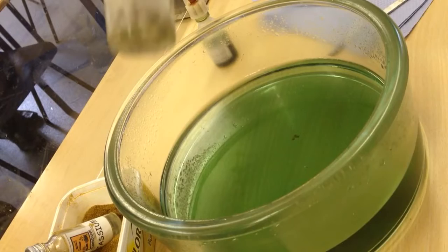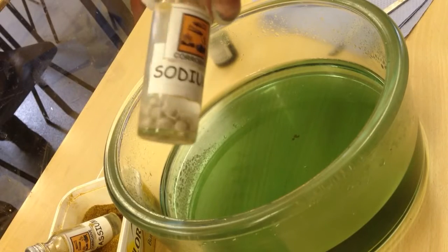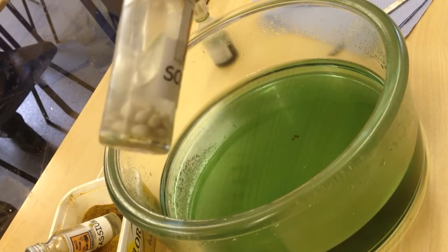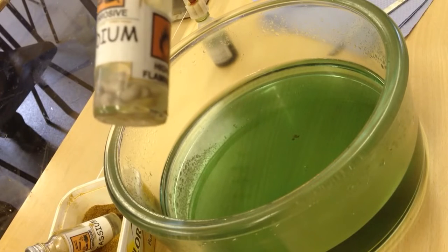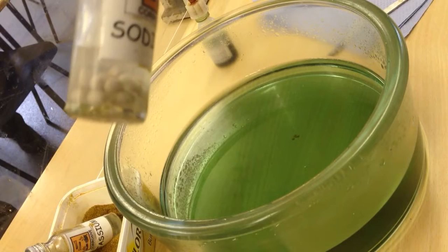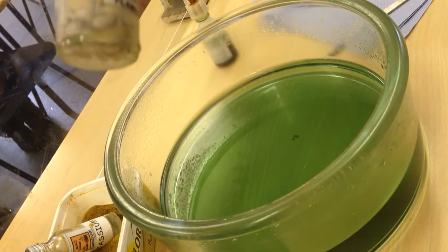And I've got three metals here and we're going to start with sodium. These are the jars of sodium, lithium and potassium and you can see that they are stored in oil. The reason they're stored in oil is because they're so reactive that they would react with the oxygen that's in the air, so we have to keep them away from any oxygen and store them under oil.